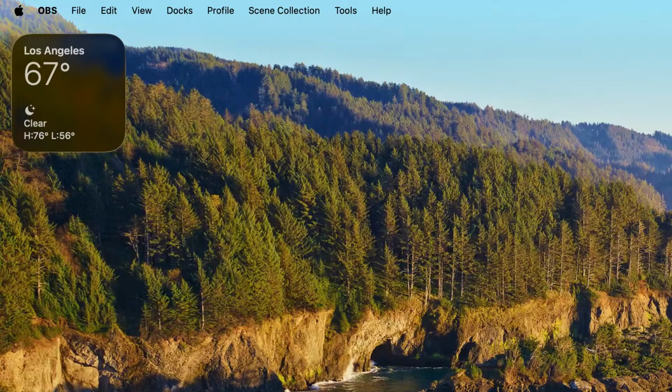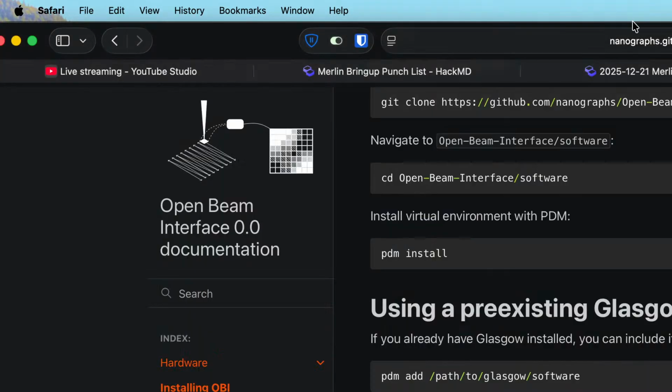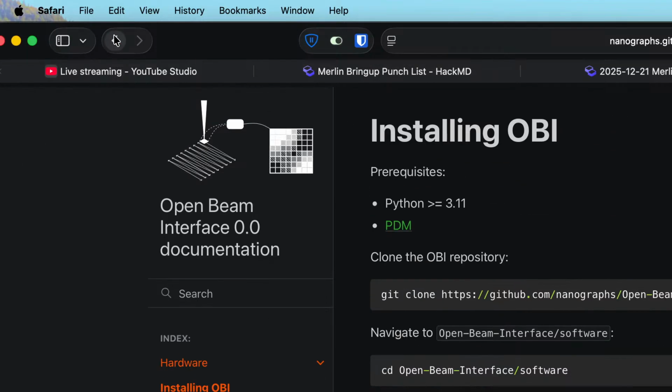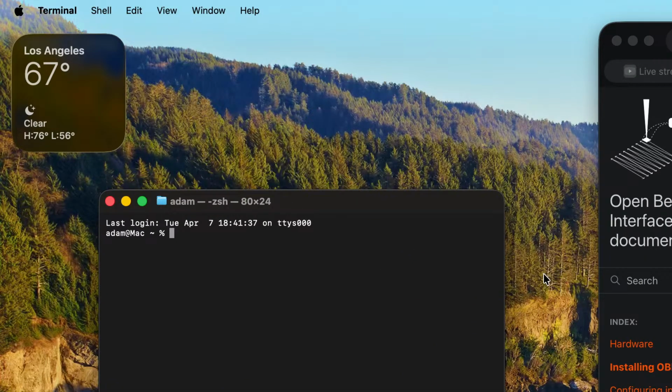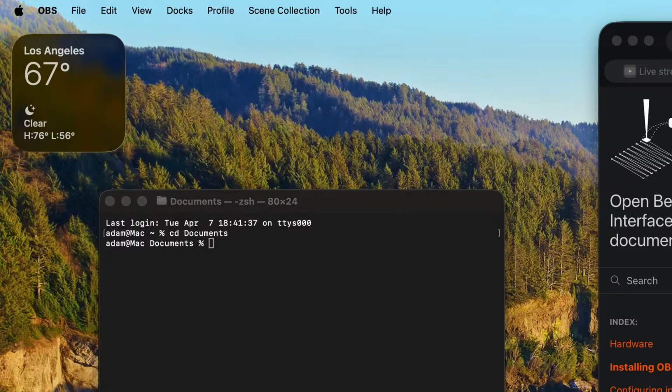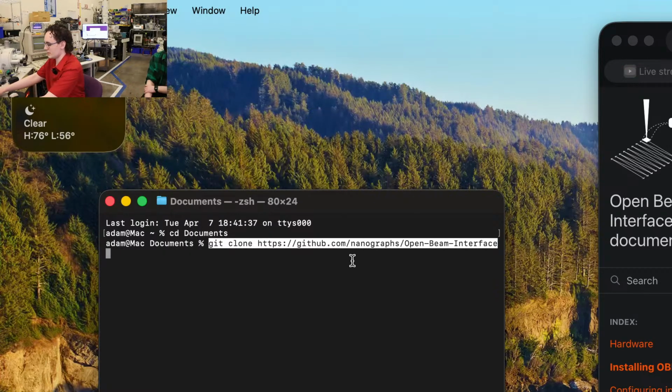Okay. So what do we need to do for open beam interface? First, we need a terminal. And we also want the installation instructions, which I got right here. So we're going to go to where we want to do this; in this case, I'm going to put it in the documents folder. Once we're in the folder we want to do the installation in, I'm just going to check OBS, make sure it's streaming what we want it to be. We are going to do our first command here, which is our git clone command. That is basically going to download open beam interface onto this computer.